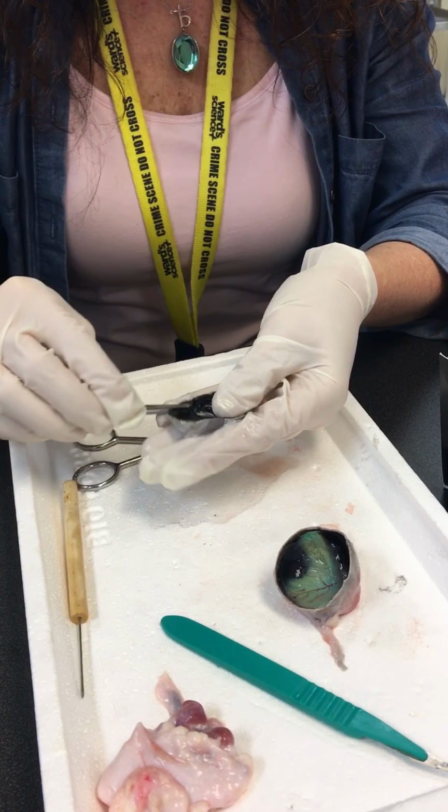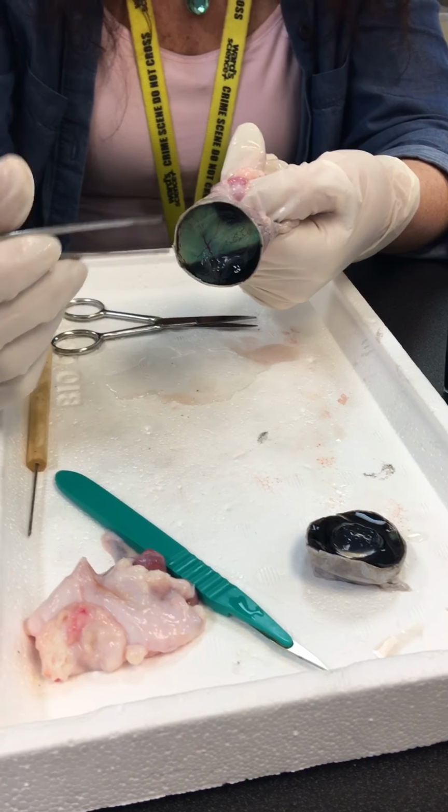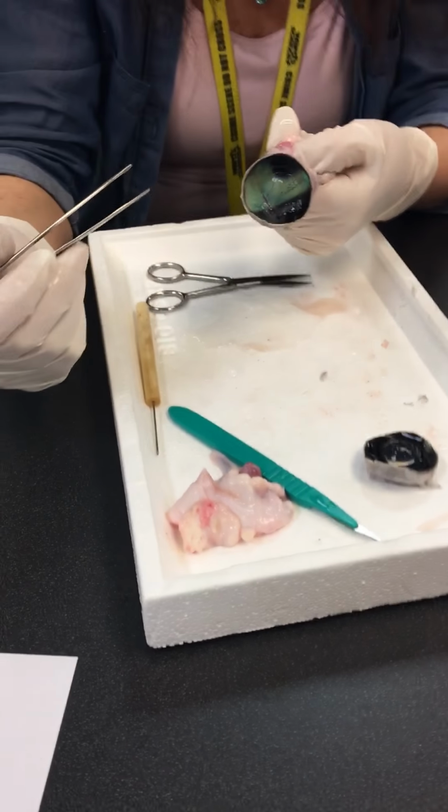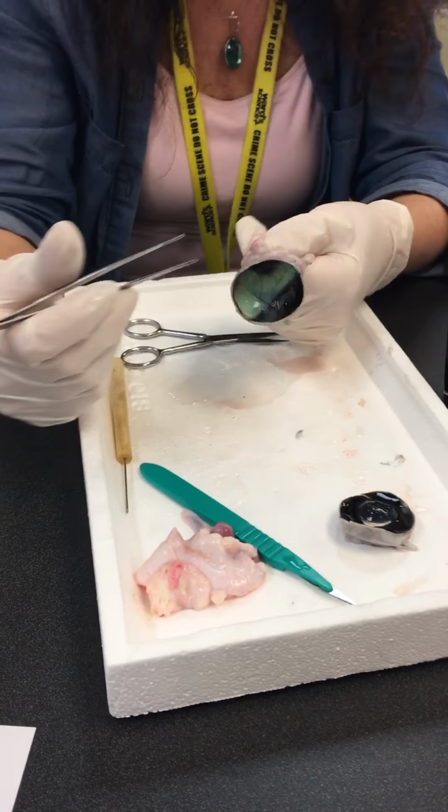That is only something you would see in nocturnal animals. So remember we talked about how you can shine a light in your dog's eyes and you would see this kind of iridescent glow in the dark, so to speak. That is where it's coming from.